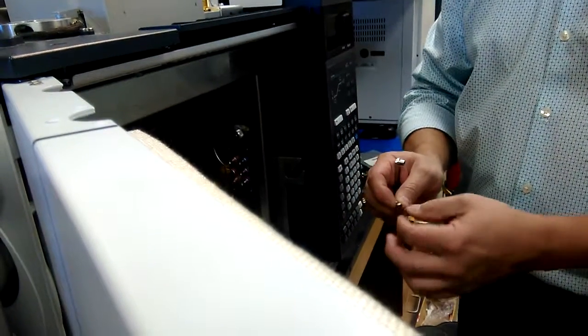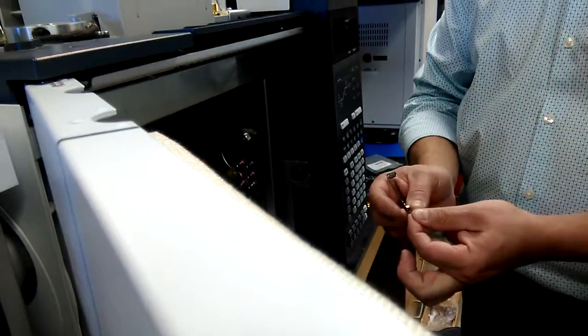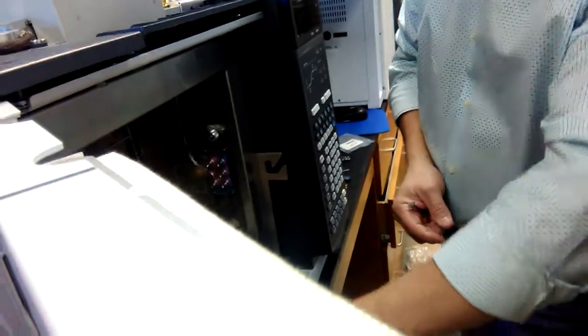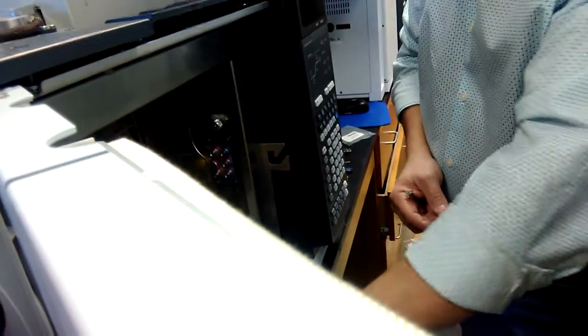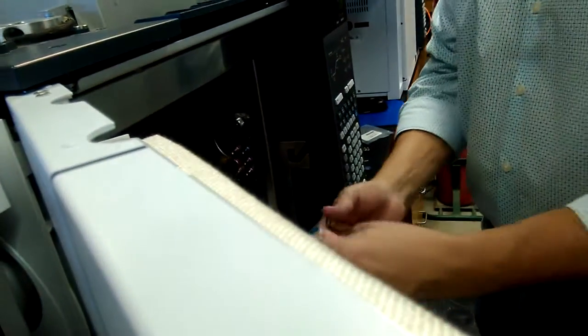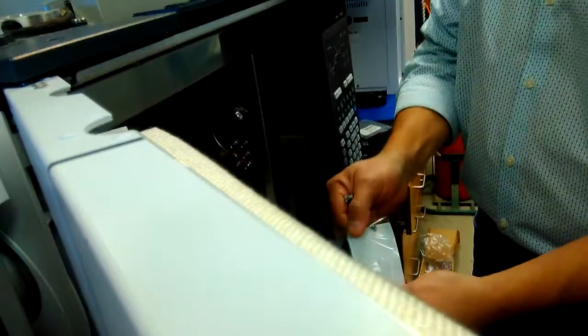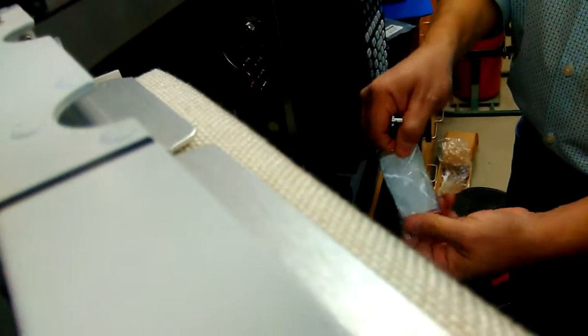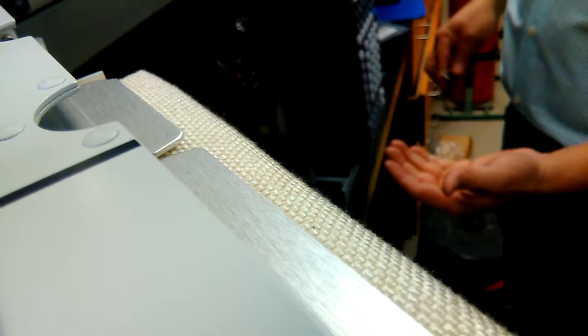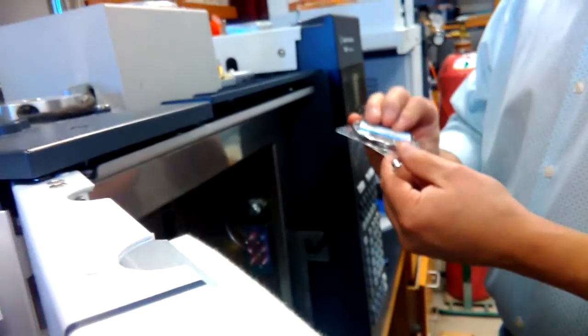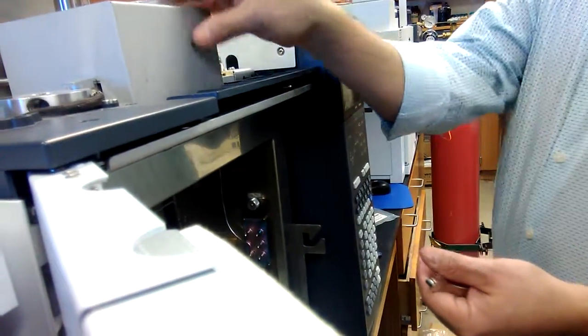And so having the little wire through the metal ferrule. All right, so when we make up these fittings we're gonna swage a ferrule onto the column. And so here's the point two oh, that's the wrong one. It's always like a hexagon, okay?